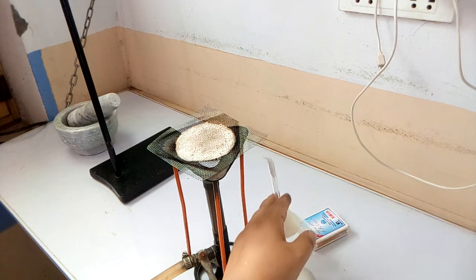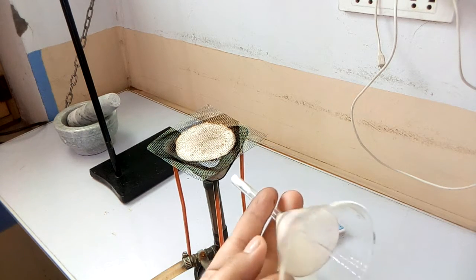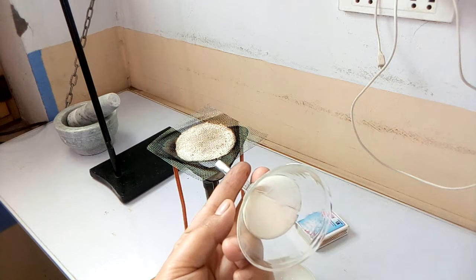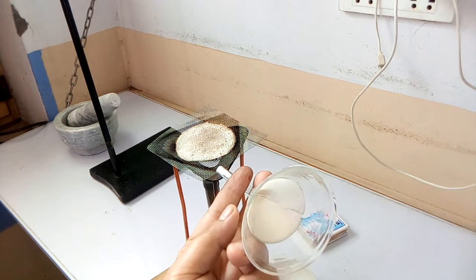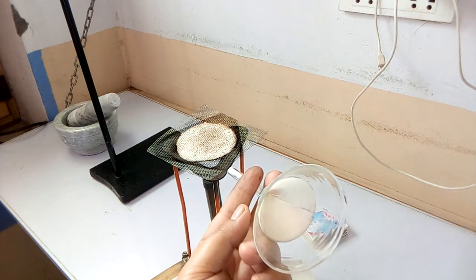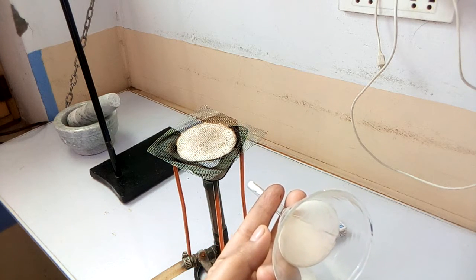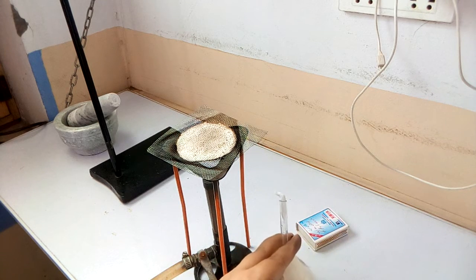We have folded a filter paper in a cone shape and moistened the inner sides of the conical funnel, then placed the filter paper cone inside it so that it is fixed firmly with the sides of the funnel. Now we will place the funnel inverted along with the filter paper on the china dish, as you can see.